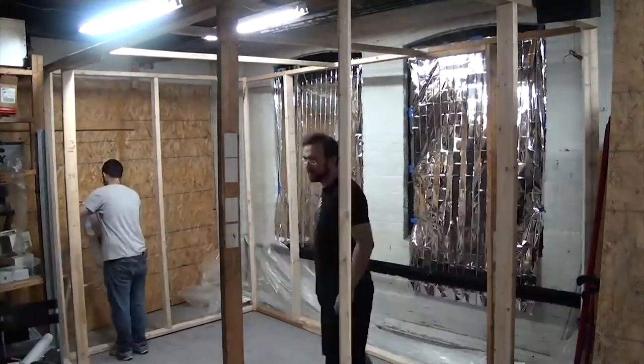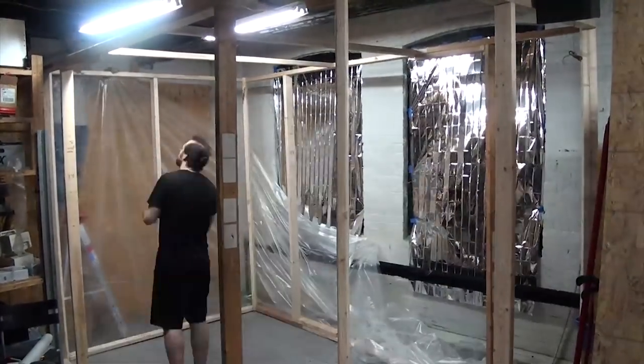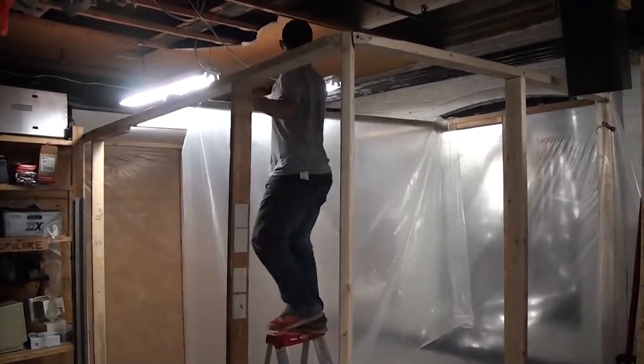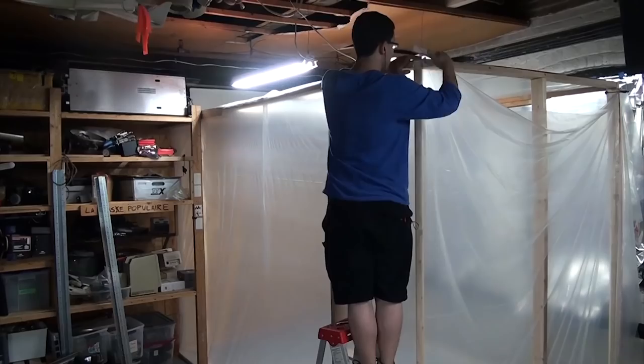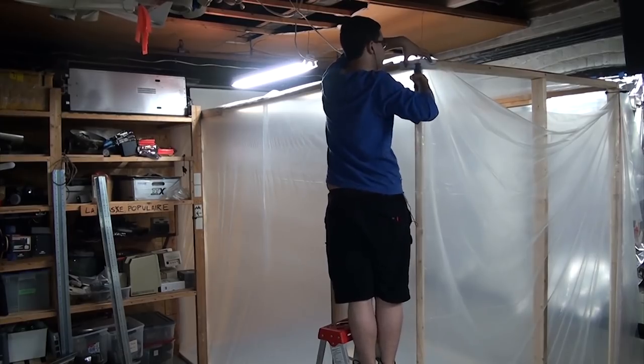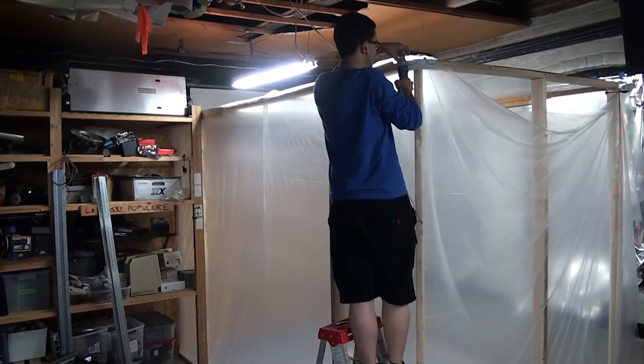With the frame done, it was time for the very tedious process of adding all the plastic. We added the plastic to the back two walls and the roof, as all these areas would be inaccessible once the frame was in its final resting place. Plastic was cut to size, stapled into place, being sure to use little pieces of cardboard on top of the plastic to help spread out the force so the plastic won't rip.